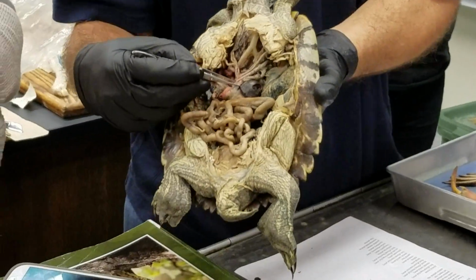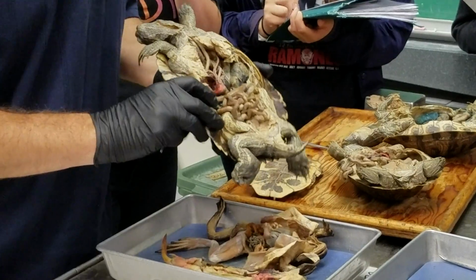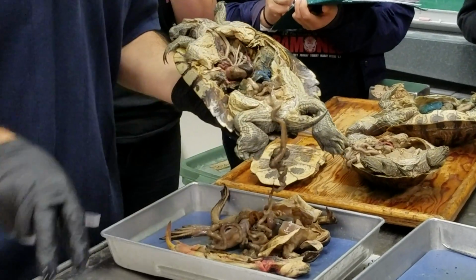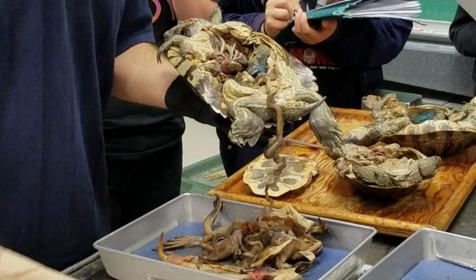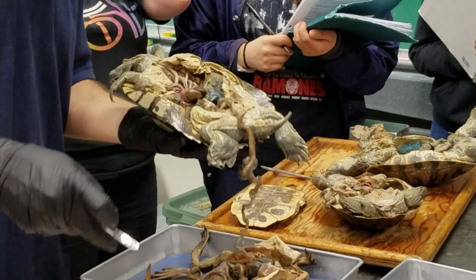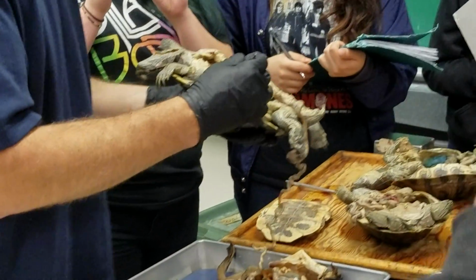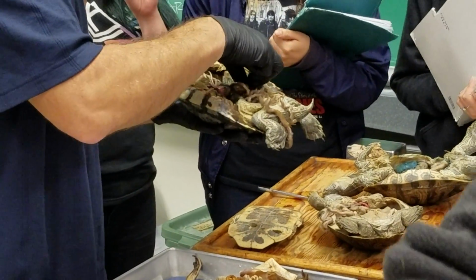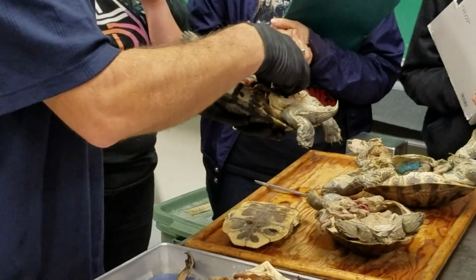What are you dripping? You're just dripping everywhere. I'm dripping, aren't I? Nasty turtle. Okay. Thank you. Kind of you. I had put covers on these books, I guess. Okay. Anyway, so that's the pulmonary arch. Okay. This next one that comes off here, I'm using some guts now too. This is very helpful. Need to hold a second turtle under that turtle. Okay.